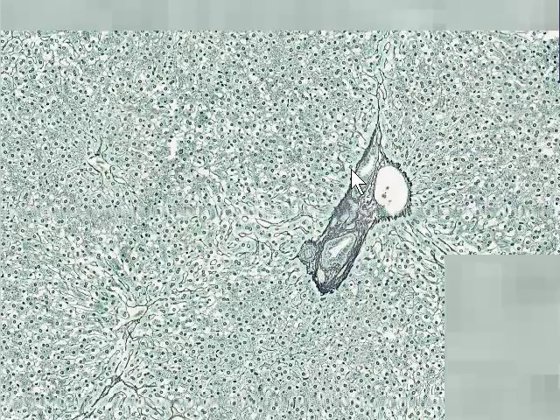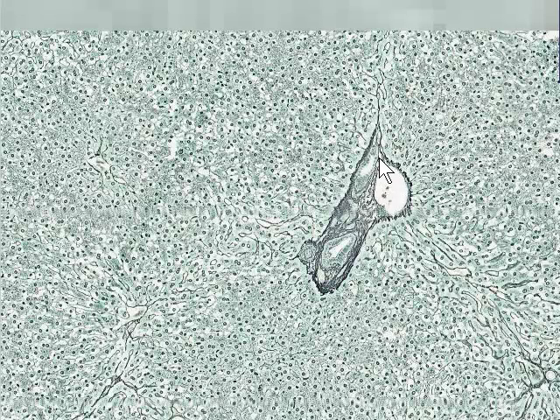So we can see nothing really at the lower magnification other than some portal canals or larger structures that feed portal canals, such as this one here, and perhaps some very large central venules, or these may in fact be portal venules. If we increase the magnification a bit, we can have a look at this structure here in a second, which is a portal canal.